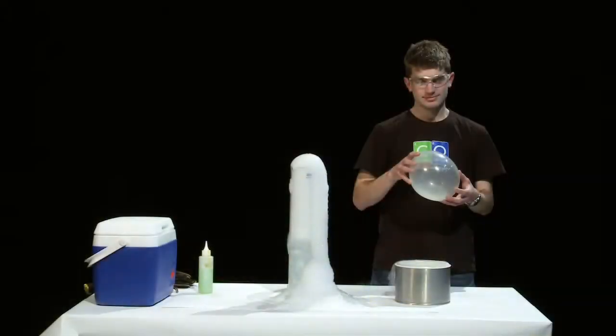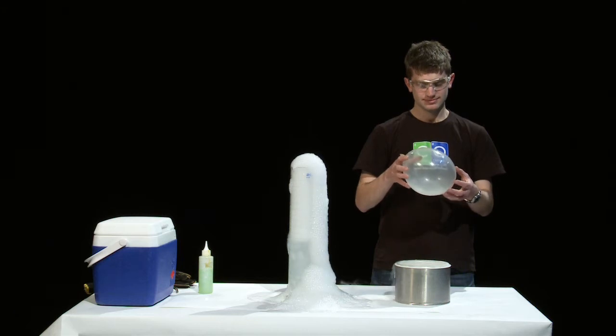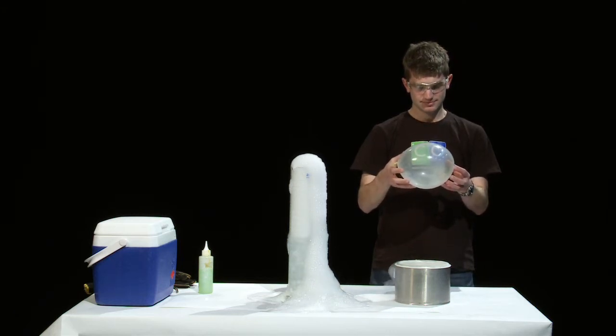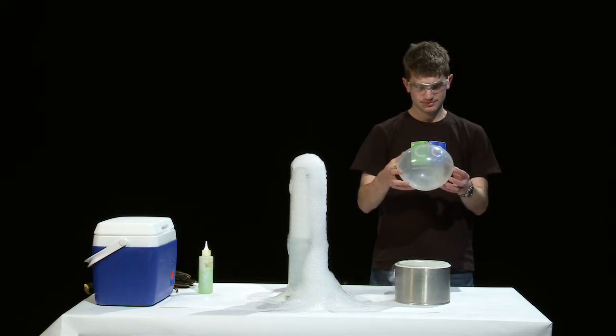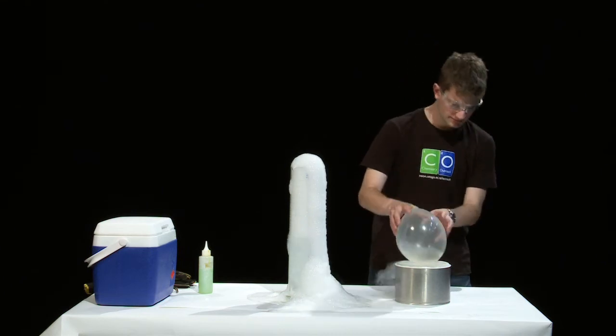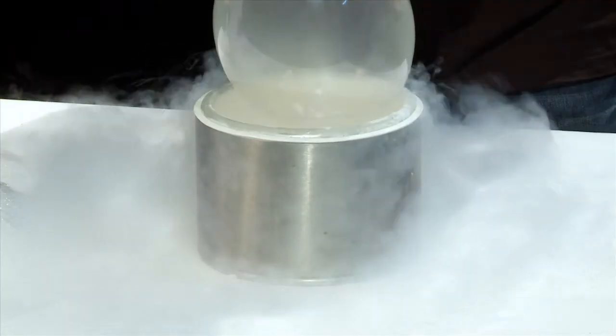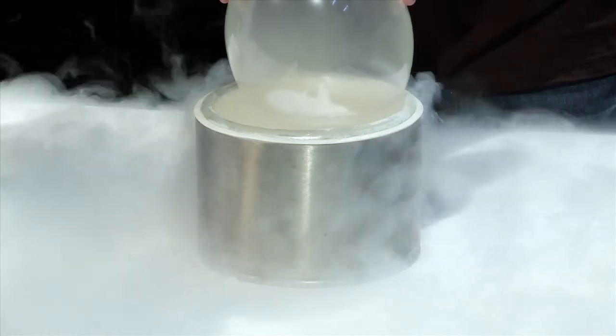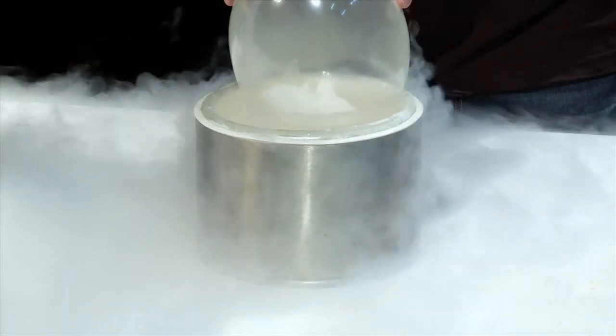And the opposite of sublimation is reverse sublimation. Here is a balloon filled with carbon dioxide. When it's placed in the liquid nitrogen, the balloon shrinks in size as the gaseous carbon dioxide is reverse sublimed back into dry ice.